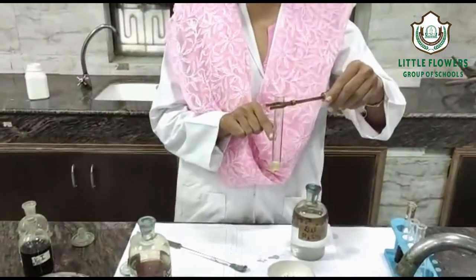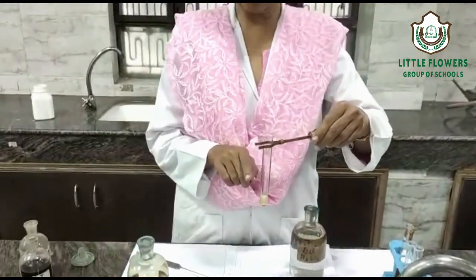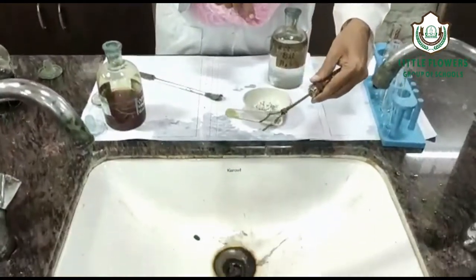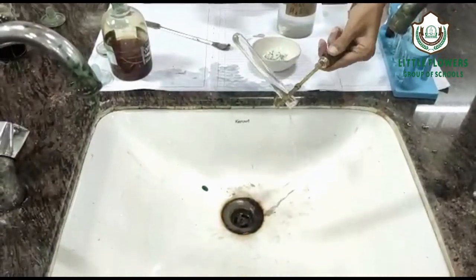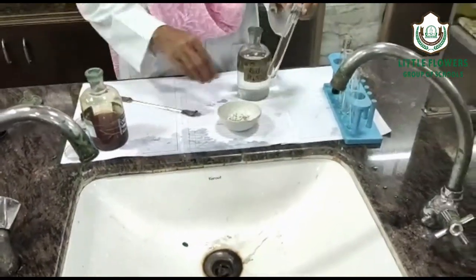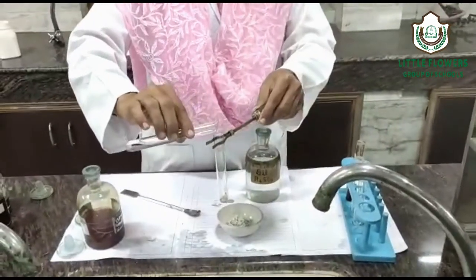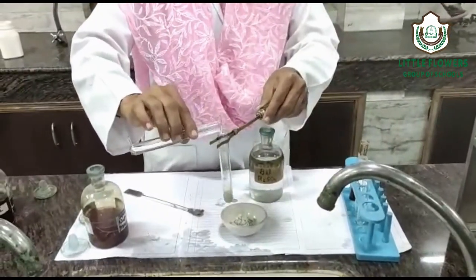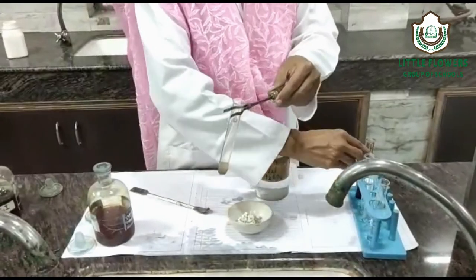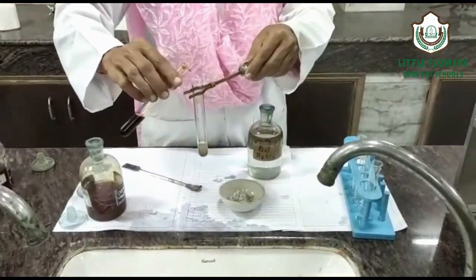If H₂S gas is produced with dilute H₂SO₄, it shows that S²⁻ may be present. Now we will take the solution of the salt, and in that solution, we will add sodium nitroprusside.